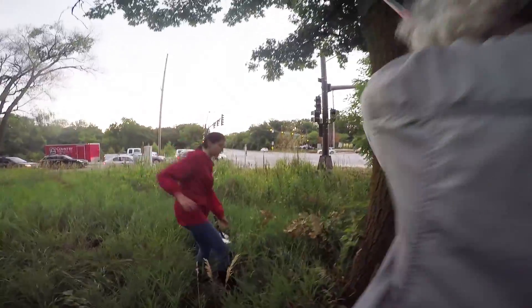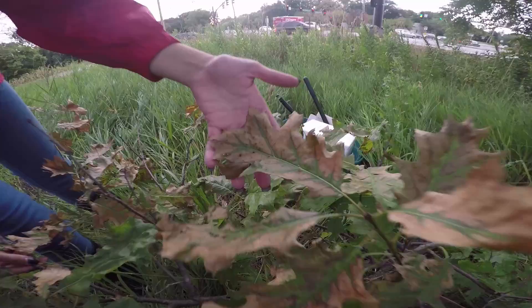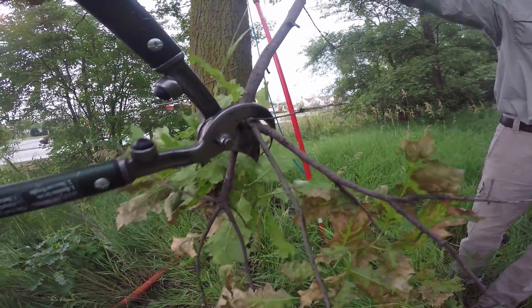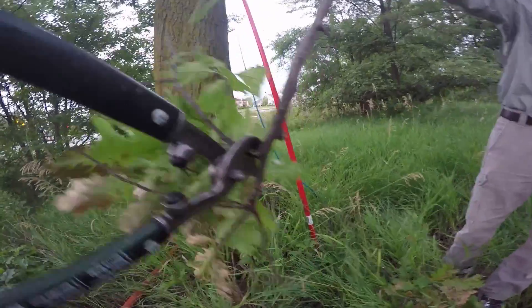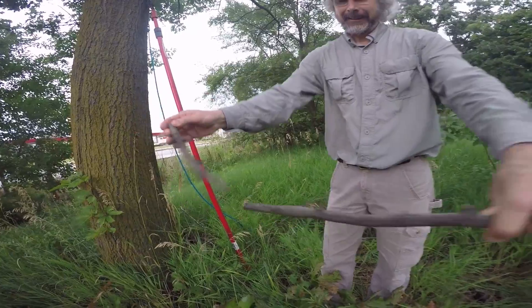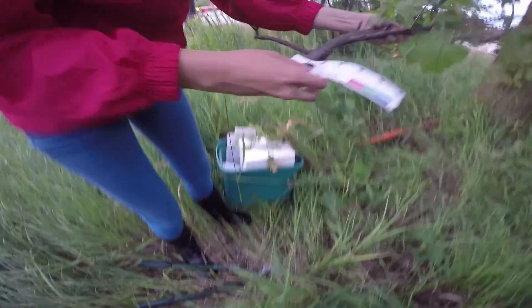Cut your branch and strip the twigs from the branch so that there are no twigs attached. Do keep some twigs plus leaves and include them with the sample in the same cooler. Then make sections of your branch that are about 6 to 12 inches in length, and make sure the branch is at least one inch in diameter.